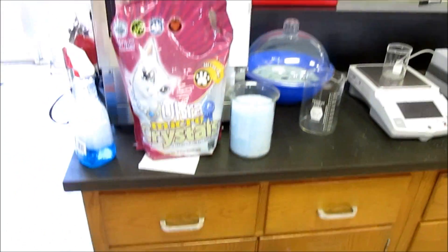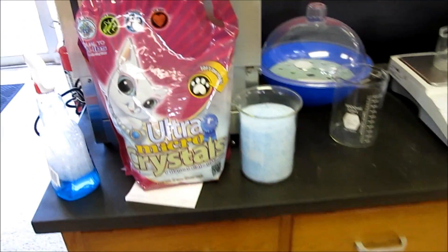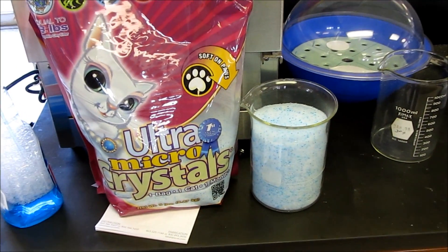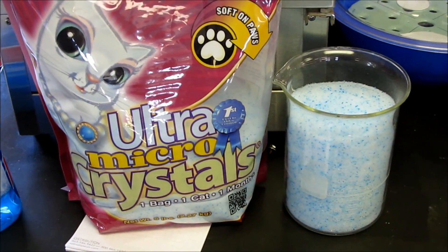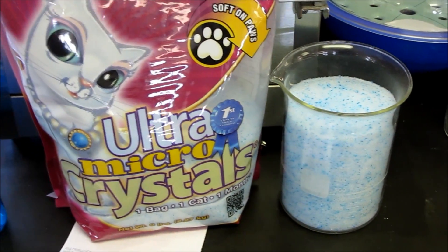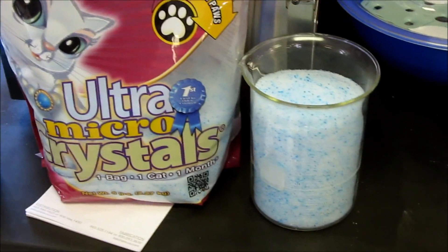One of the fun things about working here is I can do a lot of stuff I normally wouldn't do. Today I'm playing with kitty litter. The silica gel type, not the clay.